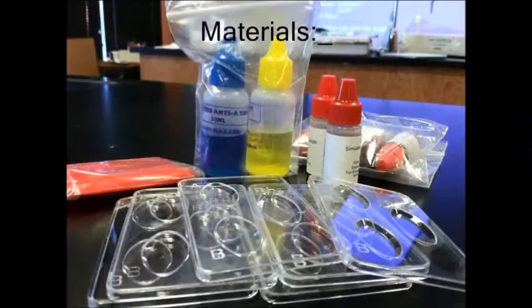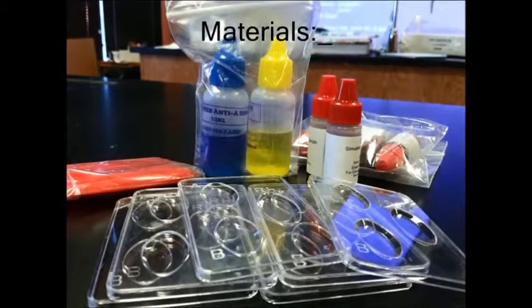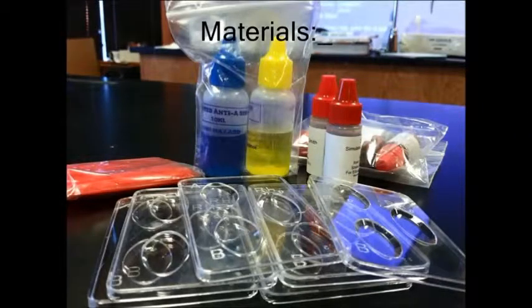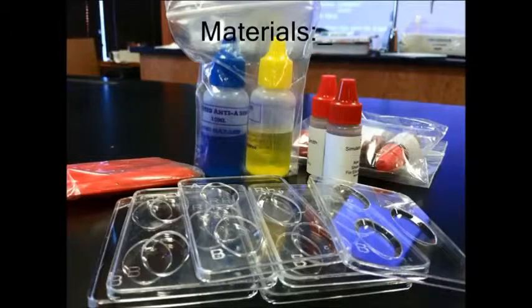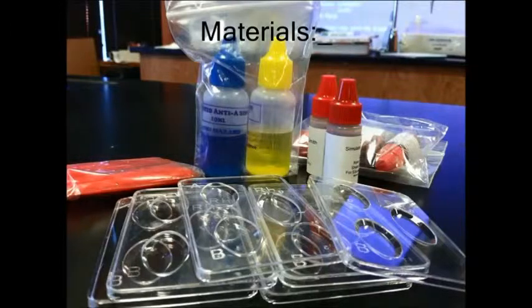The materials needed are 6 dropper bottles of simulated blood, a bottle of anti-A serum and a dropper bottle of anti-B serum, and 6 glass slides.